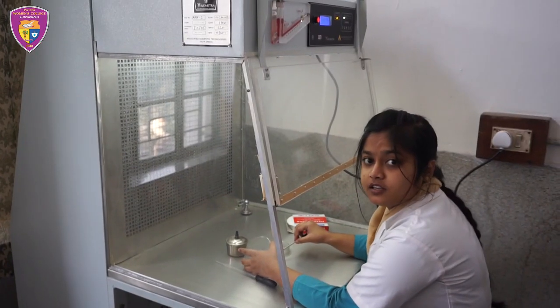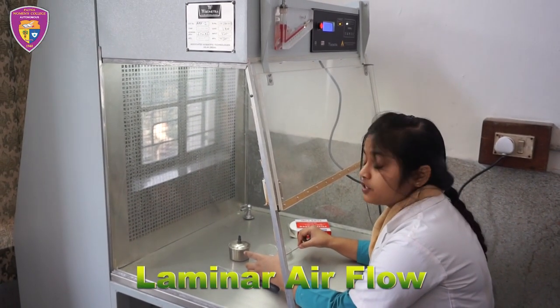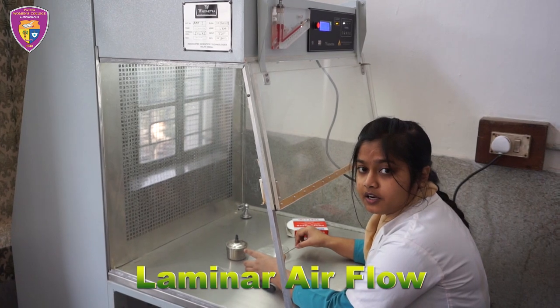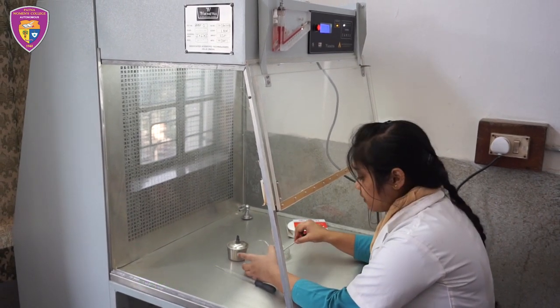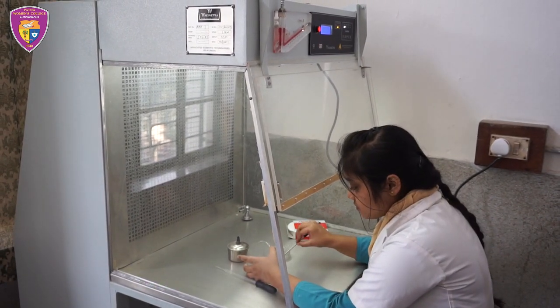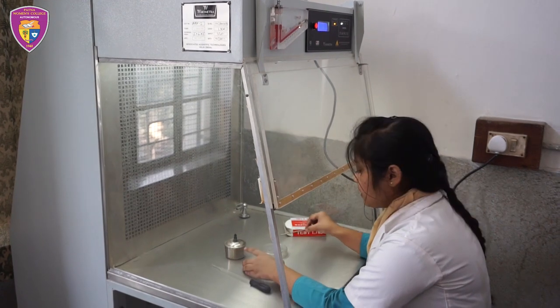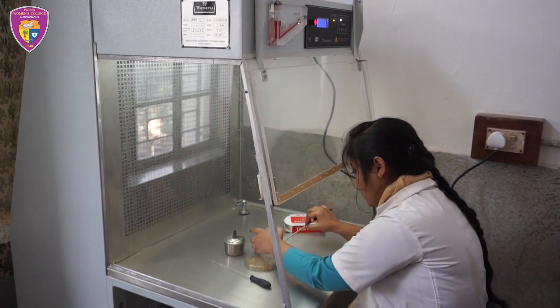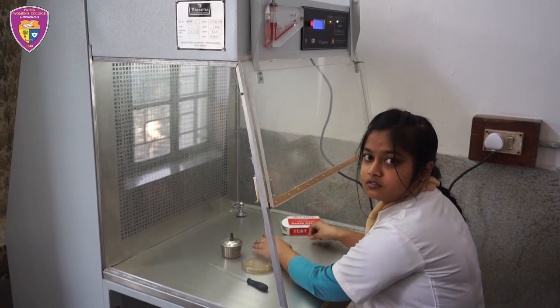This equipment is known as laminar airflow. It is used to sterilize the contaminated air in an enclosed area. Right now I am transferring Streptococcus pneumonia bacteria, going to be careful enough to avoid contamination.